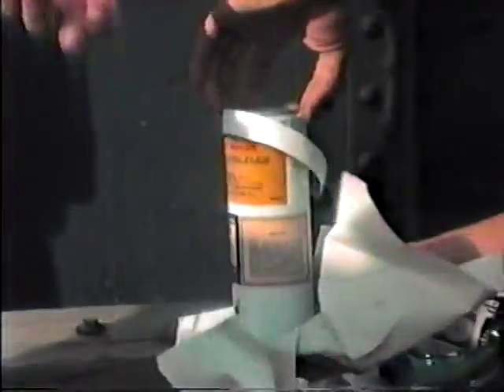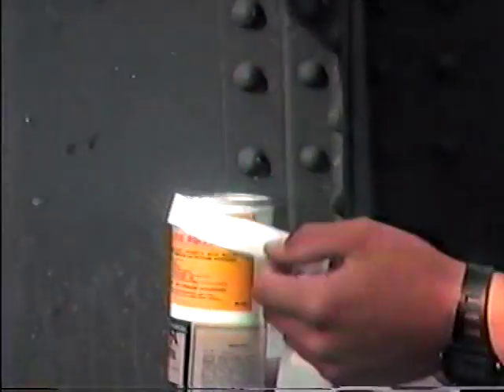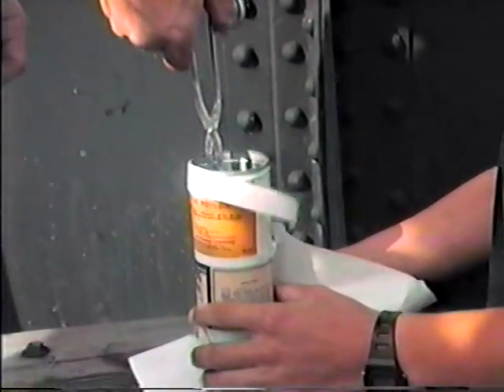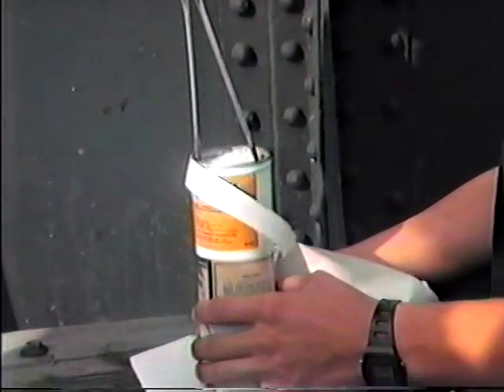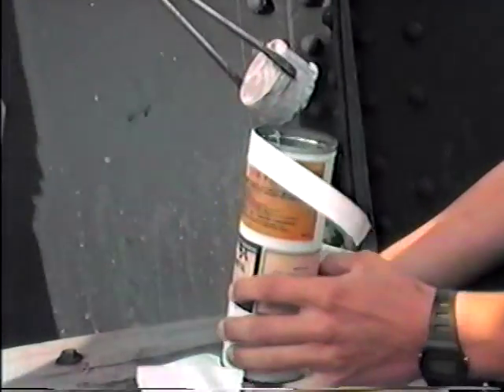What is it? Okay, Chris, go ahead now. This is the remnant of the sodium, and I want you to show everybody — the last of the sodium. Now set it down on the paper towel or something, because we don't want to spread the oil all over the place.